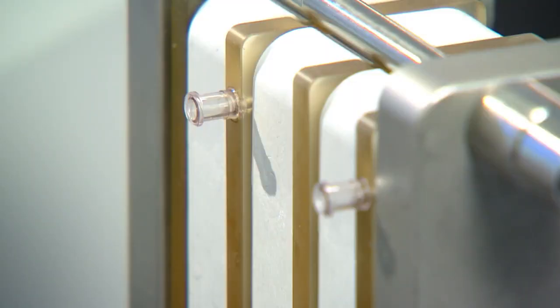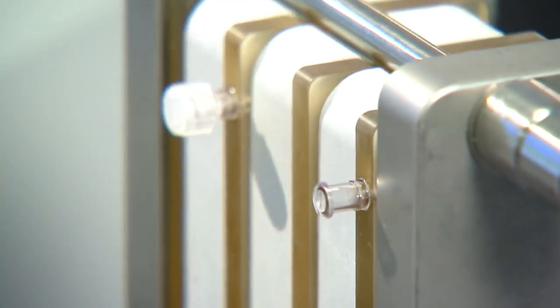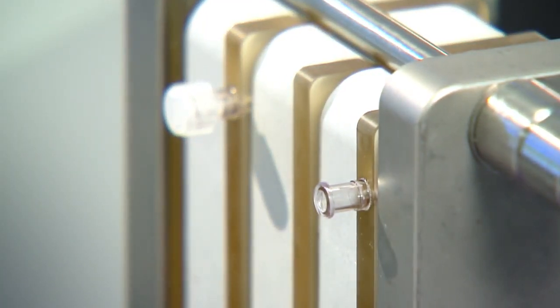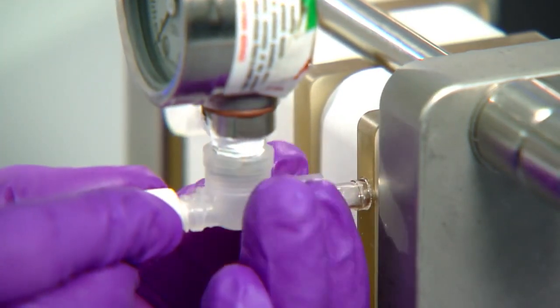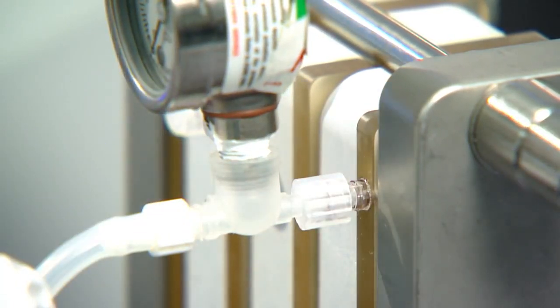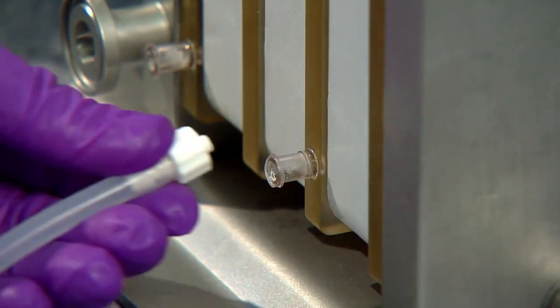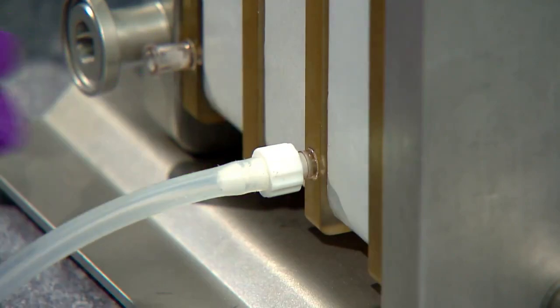On the front side of the assembly, you may cap off the retentate port from the second diverter plate. A pressure gauge can be installed for data collection if desired. A pressure gauge and hose with pinch clamp for controlling back pressure is installed on the retentate port of the fourth plate. The permeate lines are opposite of the retentate ports. Install permeate collection tubes on each port.